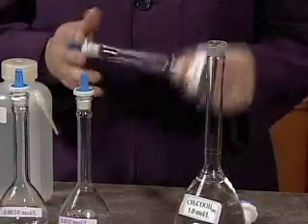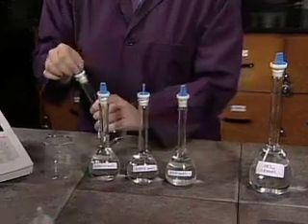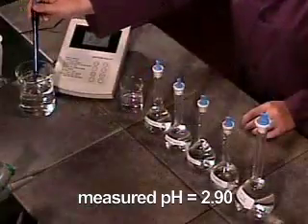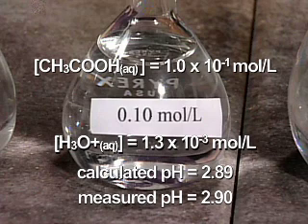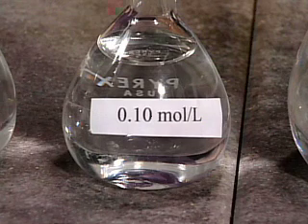The concentration of the weak ethanoic acid solution is now 0.10 mole per liter. The solution is poured into a beaker. The pH is measured and found to be 2.90. Are you surprised? Weak acids do not ionize completely. A solution of 0.10 mole per liter ethanoic acid is only 1.3% ionized. The concentration of hydronium ion in a 0.10 mole per liter solution is 1.3 times 10 to the negative 3 mole per liter.